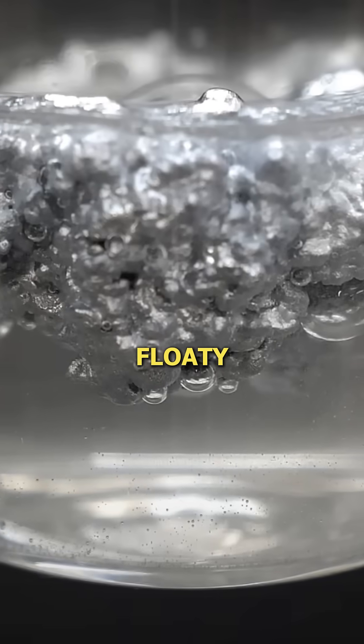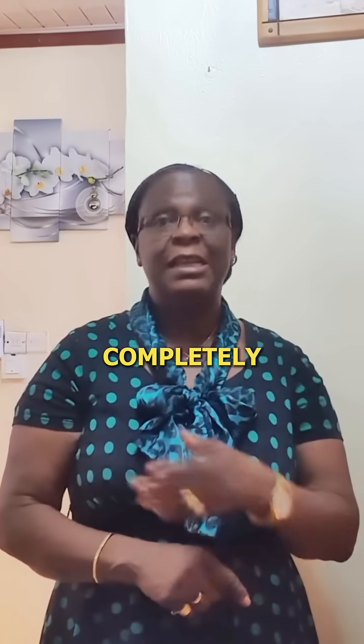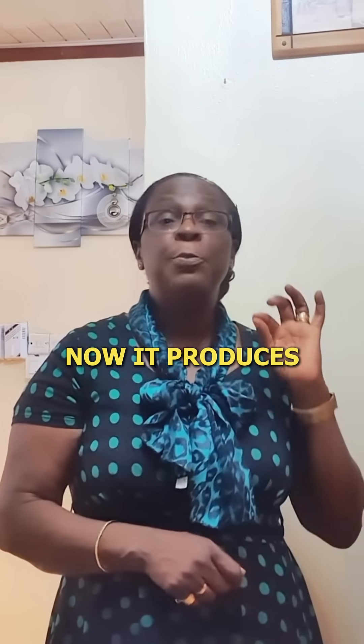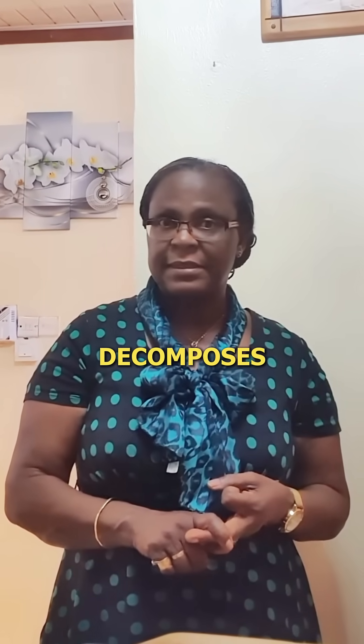It is that fluffy, fluffy gray substance you just saw. It is unstable above zero degrees, and therefore it decomposes completely within a short while if you allow it to stand at room temperature. It produces ammonia, hydrogen, and eventually mercury when it decomposes.